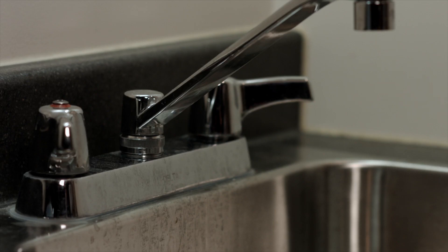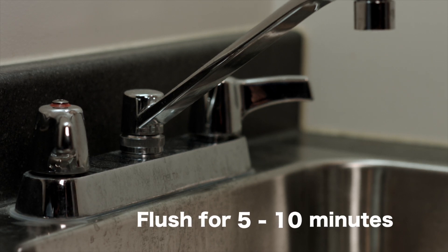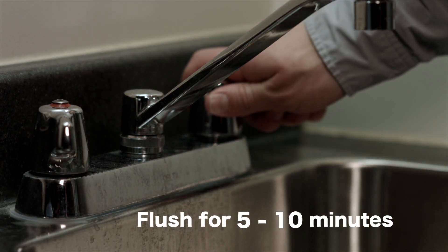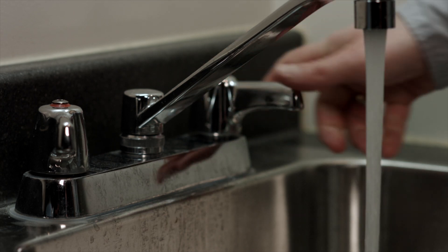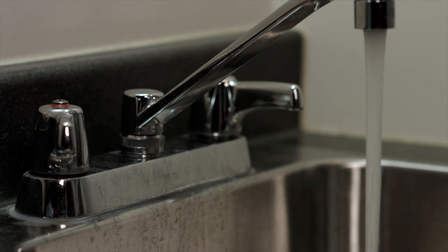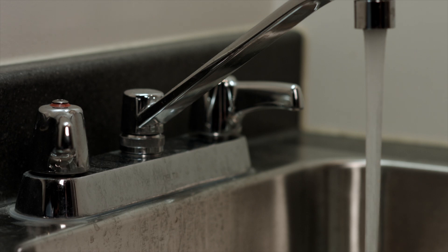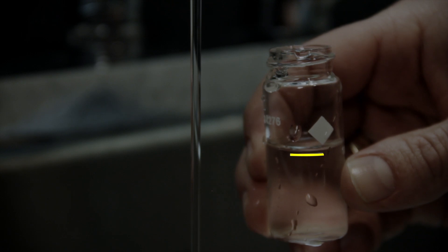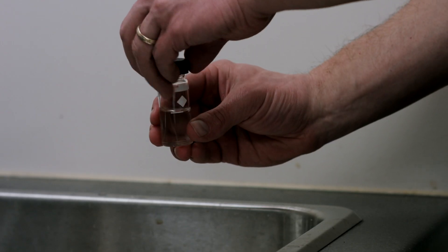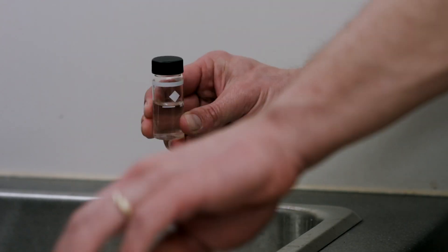To start the test, you will first need to flush your sample tap for 5 to 10 minutes. This is done so that the water you are testing is fresh from your main line. If the service line to your sampling location is quite long, you may need to flush for a longer period. After rinsing, fill the bottle to the 10 milliliter line with water from the tap. Replace the cap and wipe the bottle with a lint-free cloth to remove any moisture.